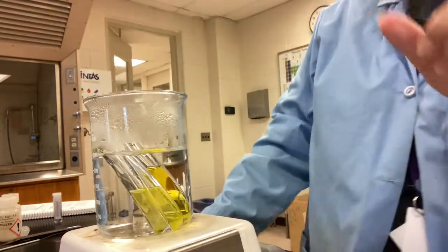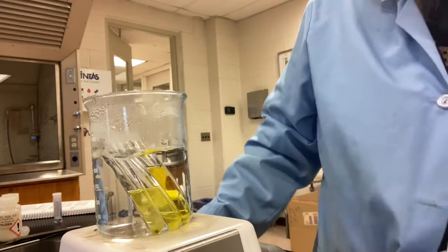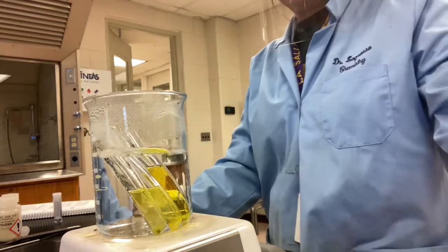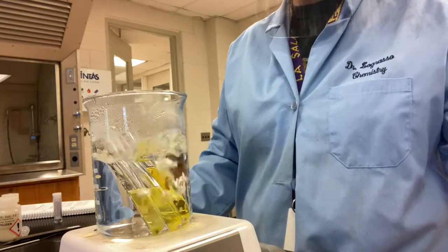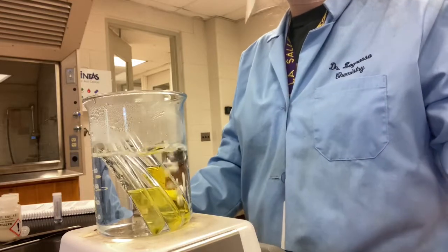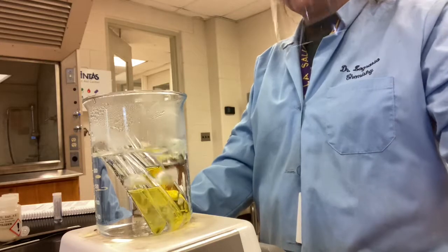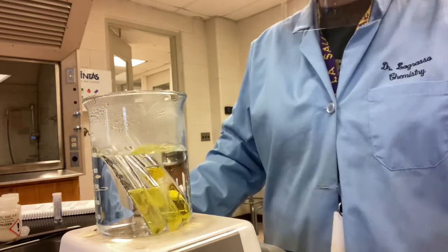And we'll give it a couple more minutes for the detergent to see if that's going to come around and form a precipitate for us. But this reaction can be a little bit stubborn. It's okay if we don't see it. That would just lead us to the conclusion that there was not phosphate in this particular detergent, or at least not enough for us to detect with this particular test.